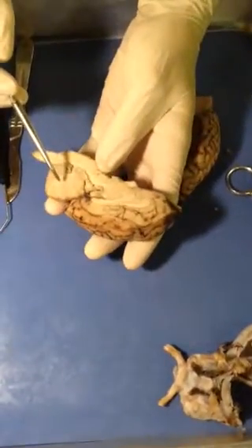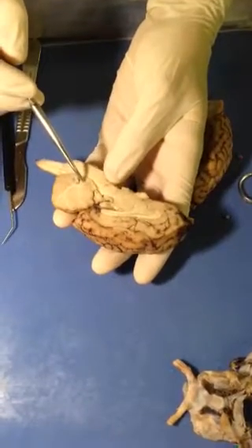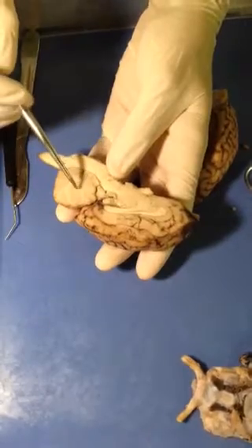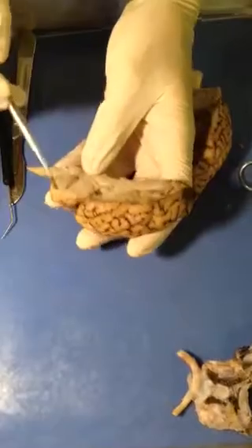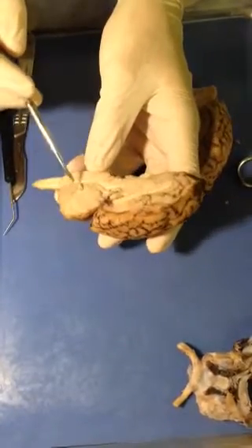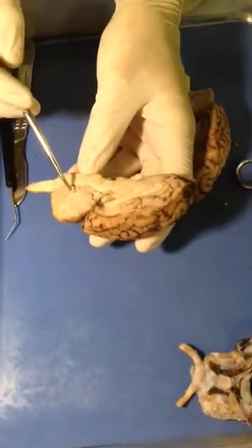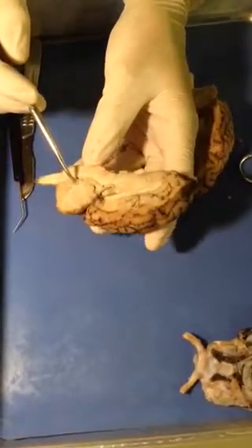Inside the cerebellum, we have the arbor vitae, or what's known as the tree of life, and that's just distinguished by the white matter branching up, going into the darker gray matter. On the top of the cerebellum, all the little ridges up here are known as the folia, and then back down at the bottom of the cerebellum, right by the fourth ventricle, is what is known as the flocculonodular lobe.